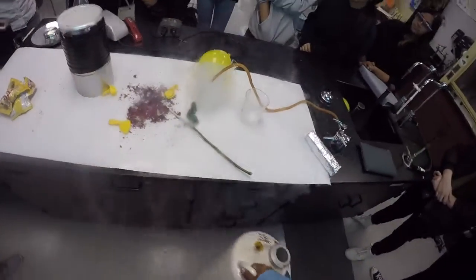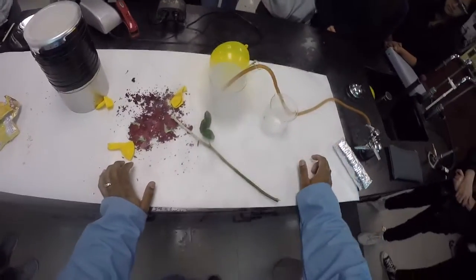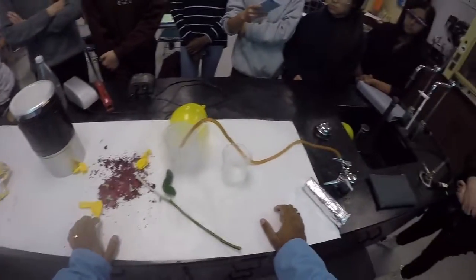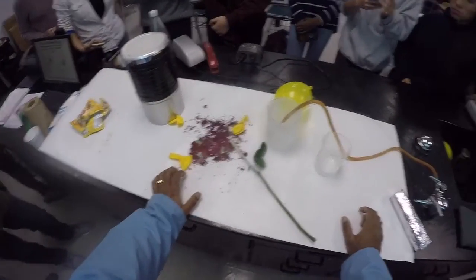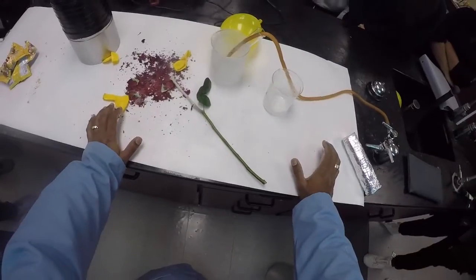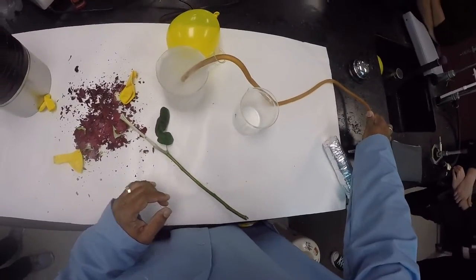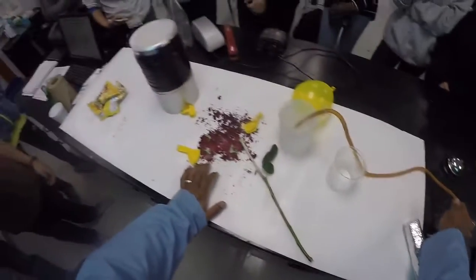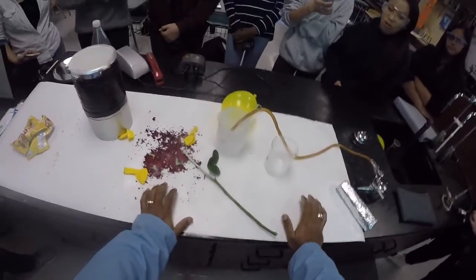Right now, the methane, when it makes contact with the really cold sides of the test tube, is going to want to condense to a liquid, right? Because that's what happens to gases when they cool down. They condense to liquids. And so what I'm going to try to do is make some liquid methane. Now, it does take a little while. It takes a good 5 minutes or so to get enough for me to do anything with it.